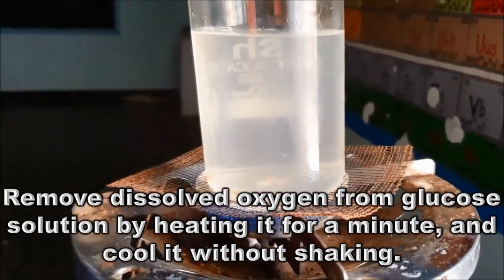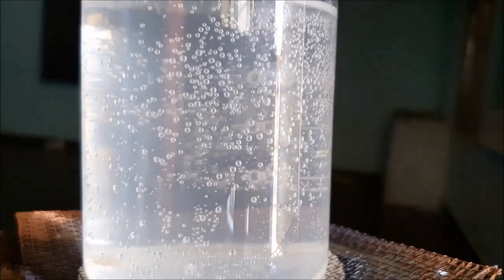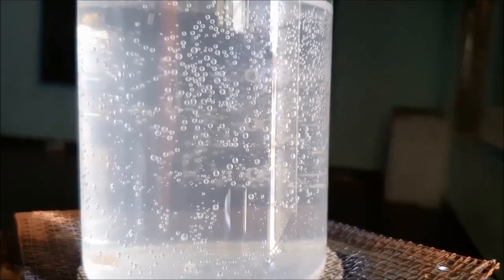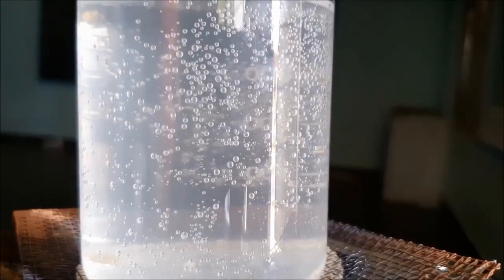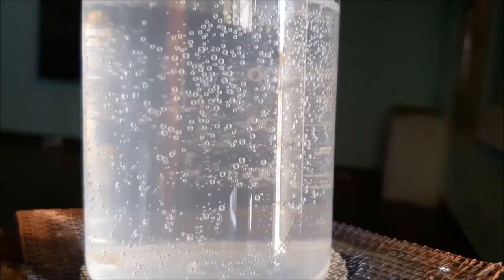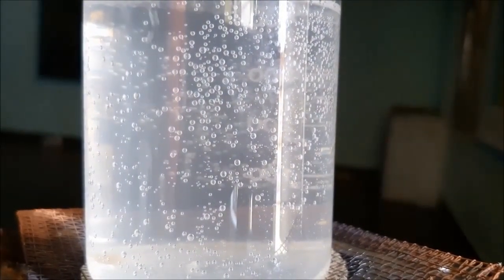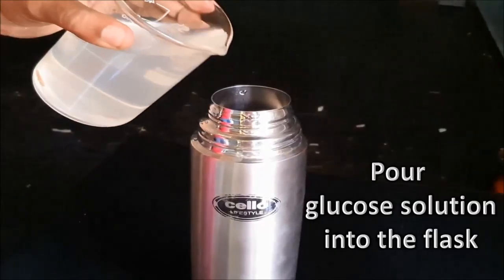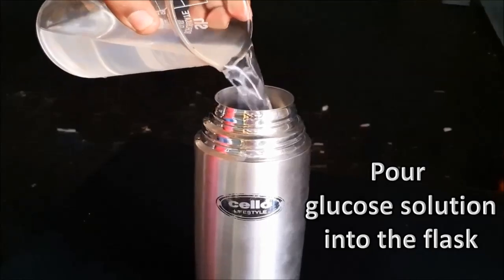So after boiling, you can observe air bubble formation. It clearly indicates that oxygen is removed from the glucose solution. Pour the glucose solution into the flask.